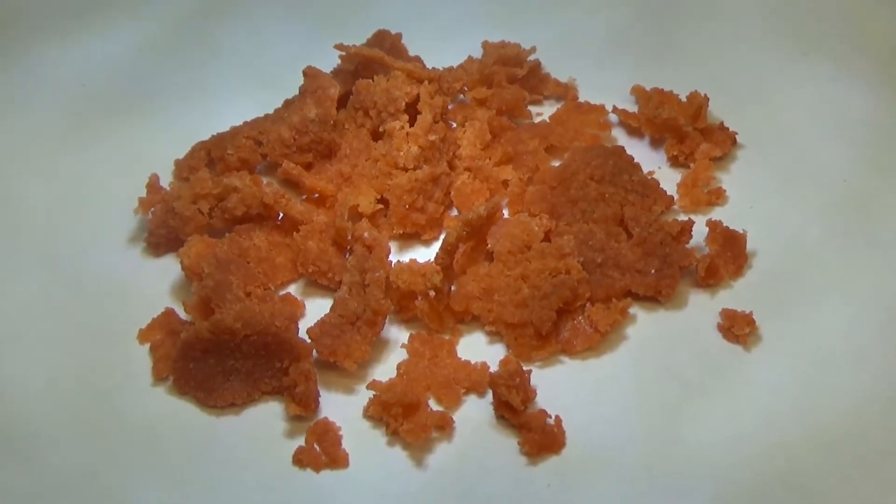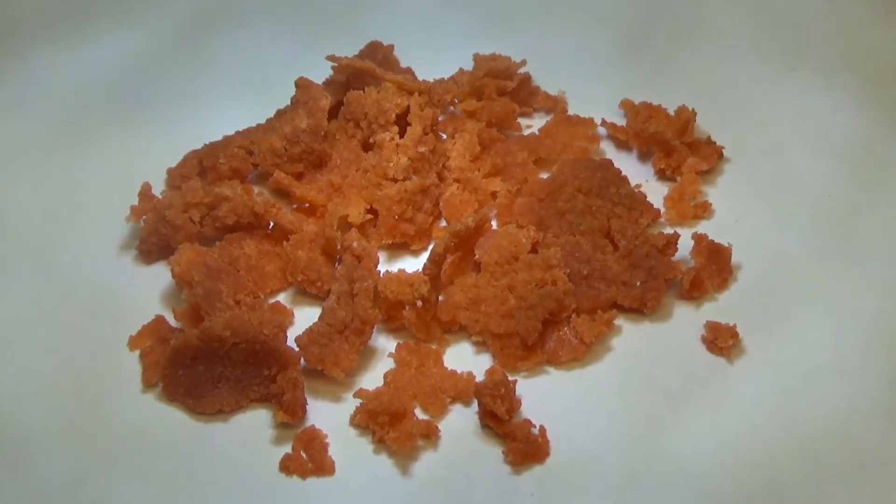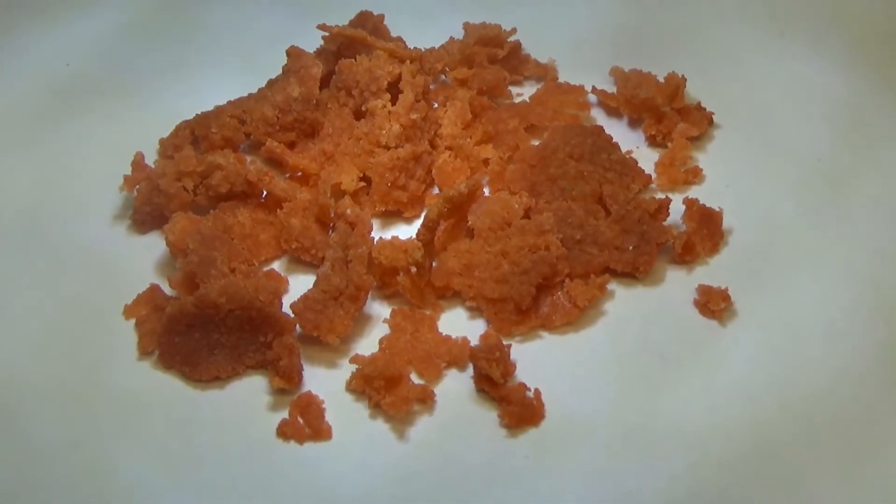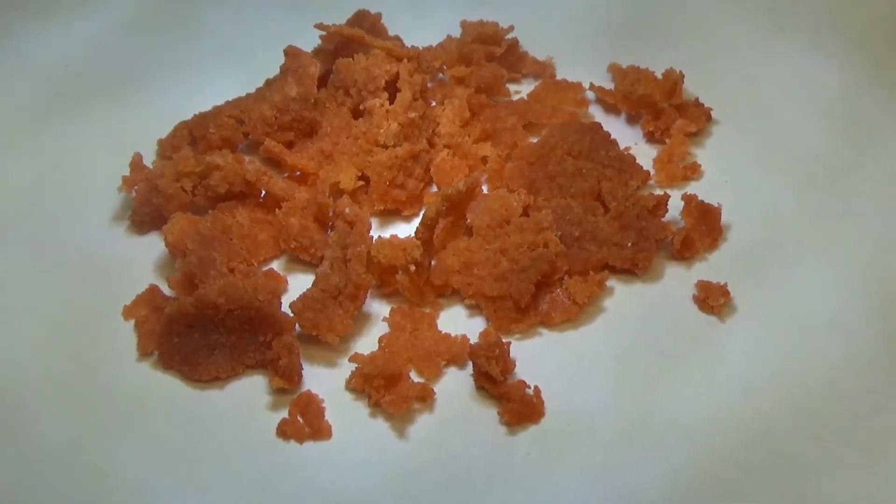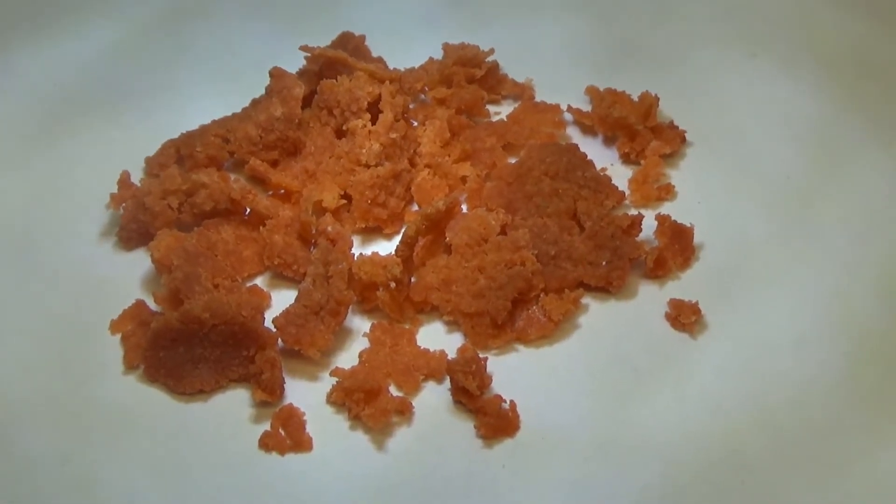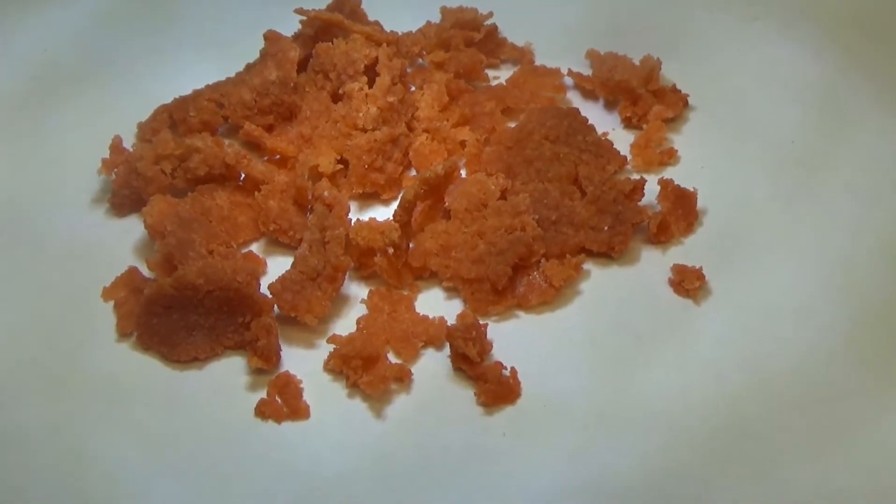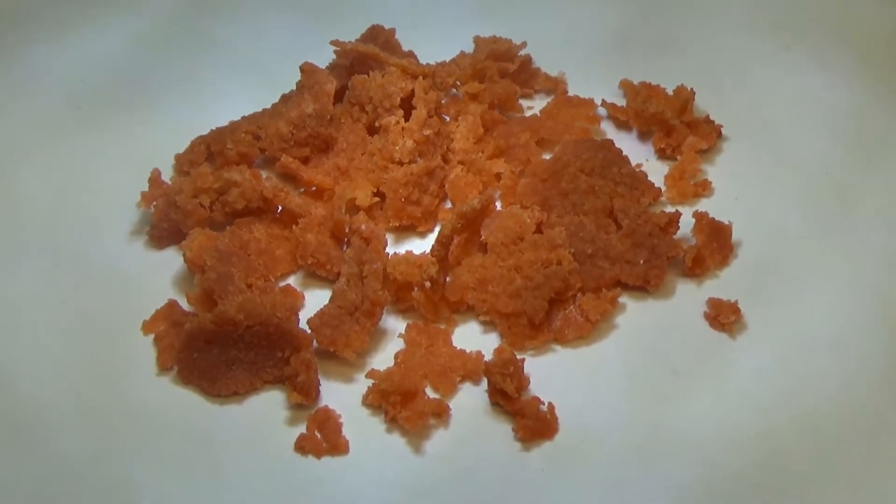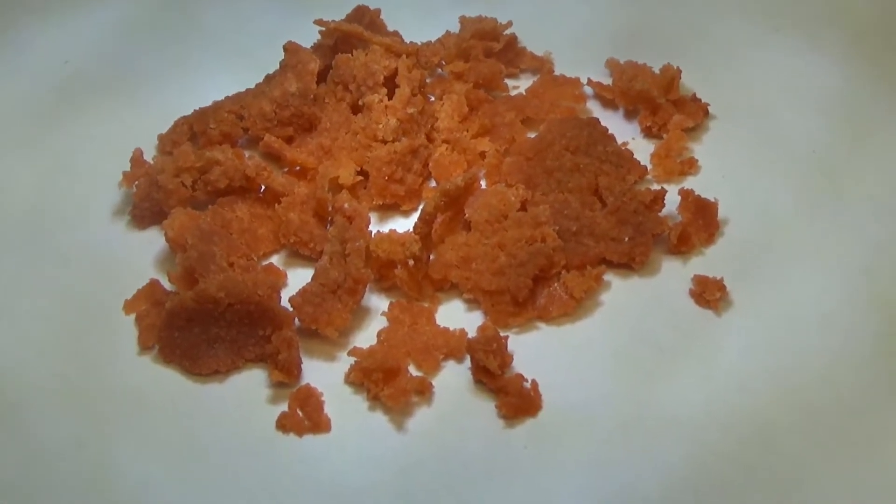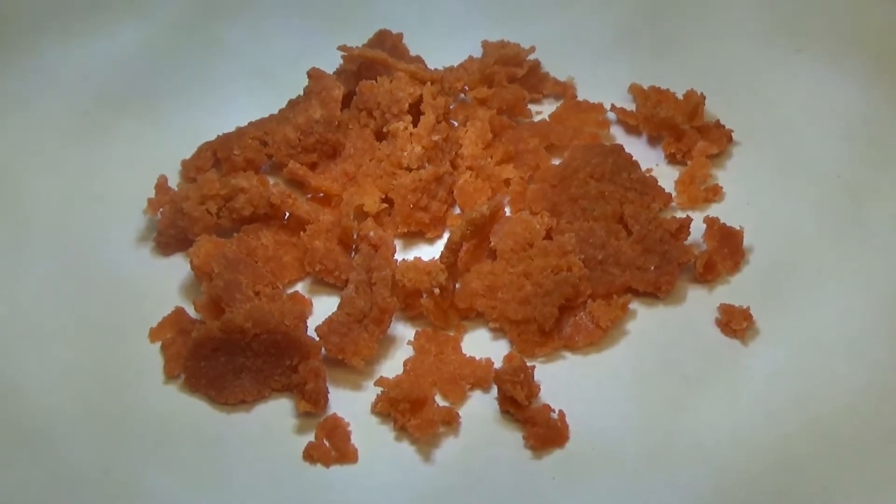The real proof will be when it gets carbonized. In the next couple of shots here, I'll show you a couple of more microscopic views. And the biggest thing is that in both of these cases, I'm getting crazy good mixture of the carrot powder with the salt. And I'm hoping that that will lead to very consistent carbonization when I put it in the microwave.